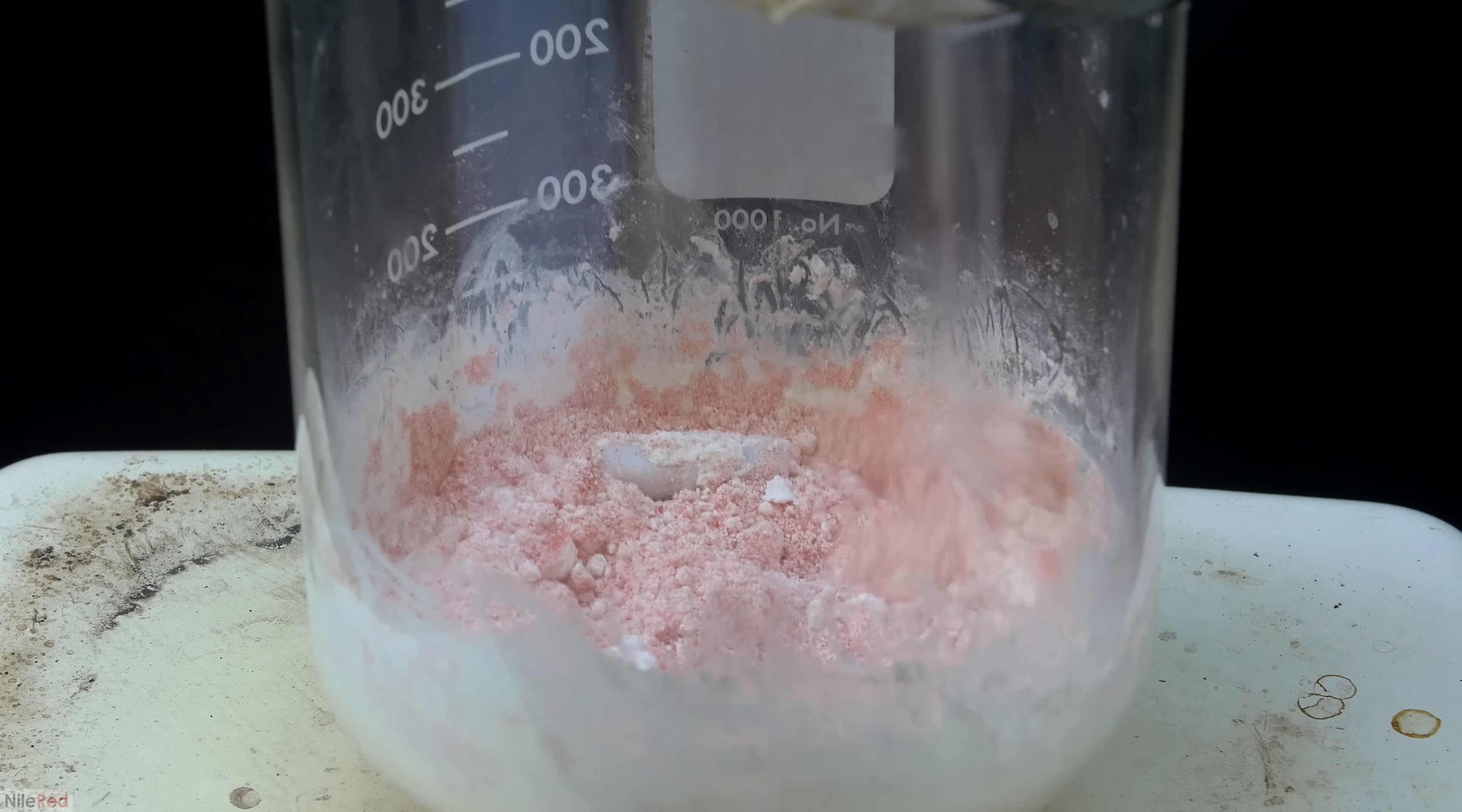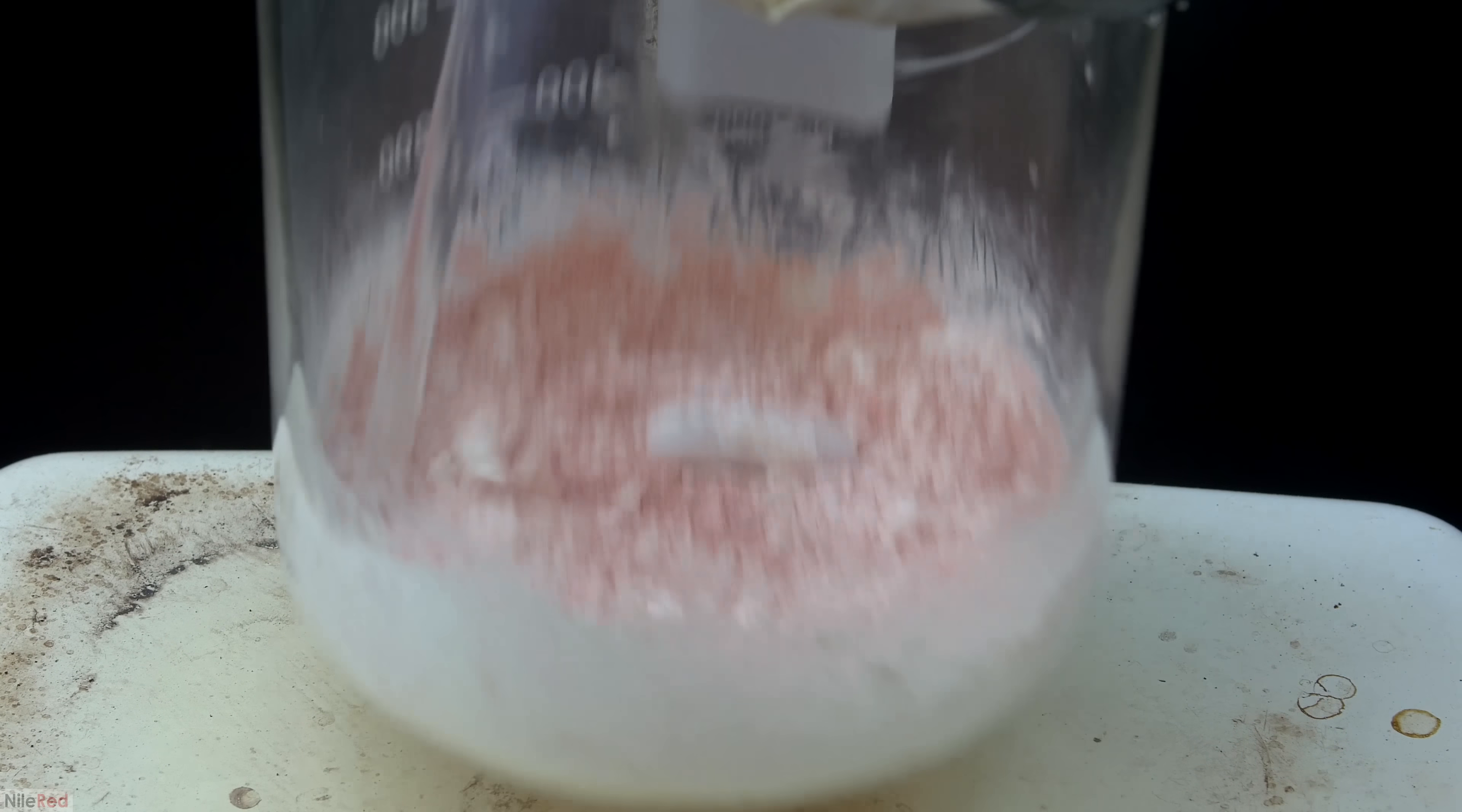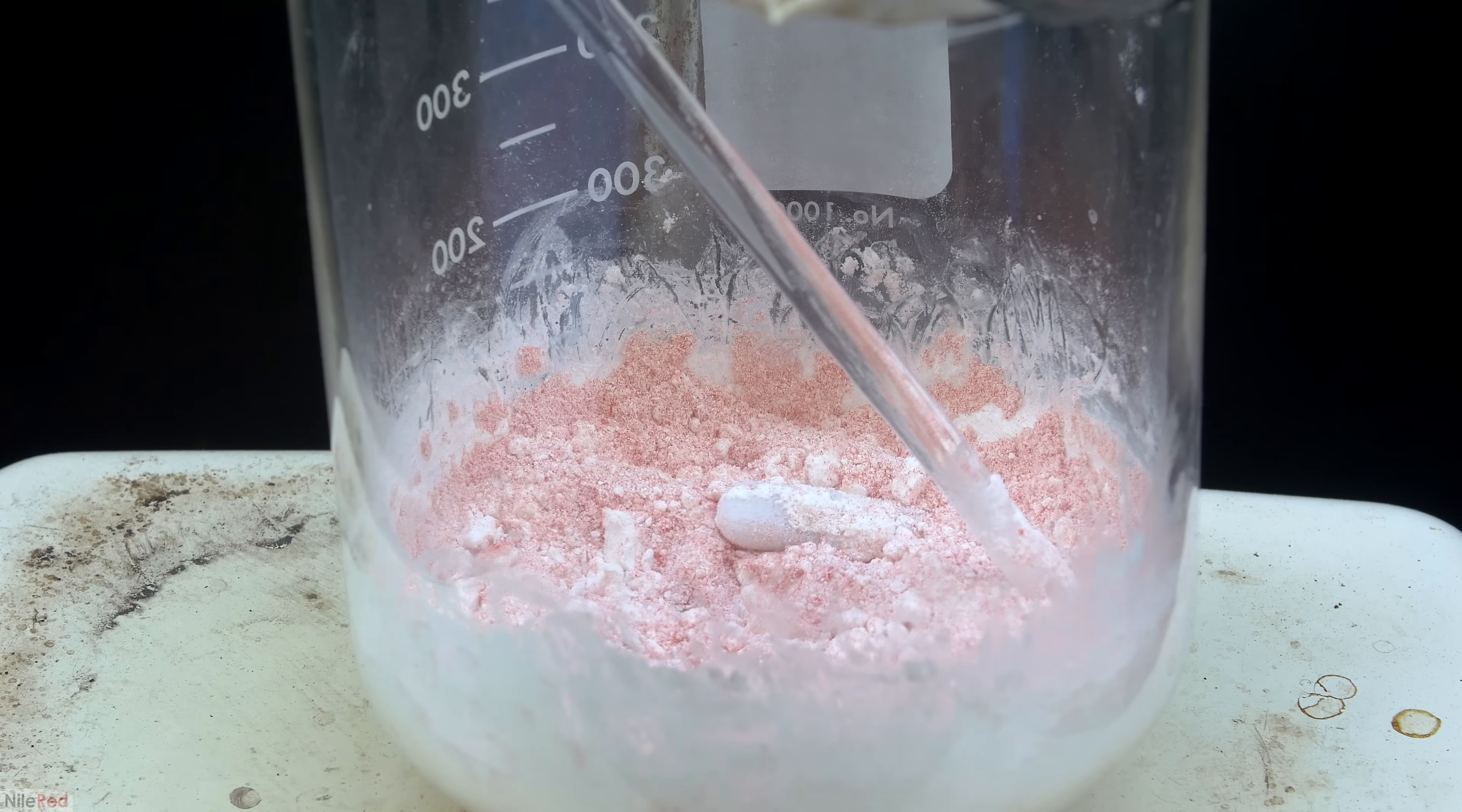Eventually, we stop seeing nitrogen dioxide gas, which indicated that the reaction is more or less over. Just to be sure, I continued to heat things for a while, and in the end, I was left with a pale red powder. There were still some white chunks left over, but no matter how much I heated it, it didn't seem to break down.